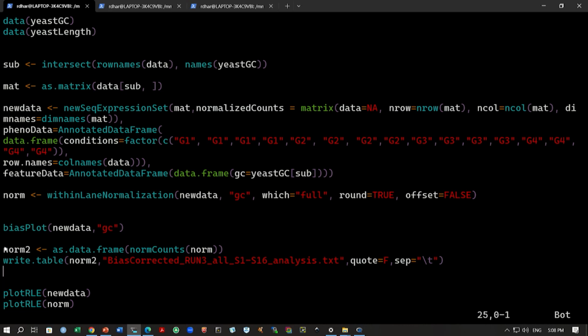So, to export this data, I will use the command norm counts on norm. It will get the normalized count data from this normalized data set. So, this norm is the normalized data, and if you use norm counts on norm, we will get the normalized count. And we want to store this as a data frame inside the variable norm2. In the next step, we will write this norm2 variable using the command write.table.